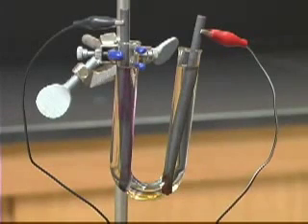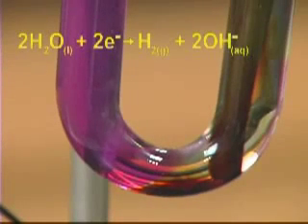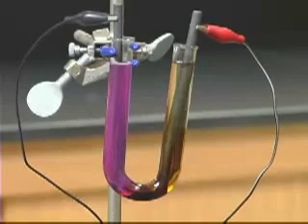So at the cathode, we'll see the evolution of hydrogen gas. The solution will turn pink due to the formation of hydroxide ion.